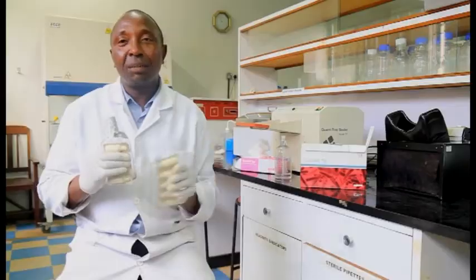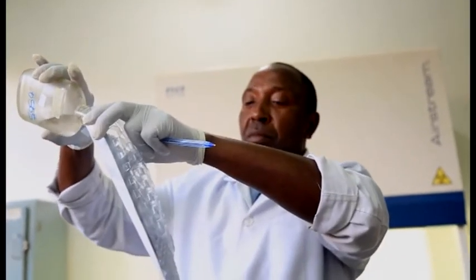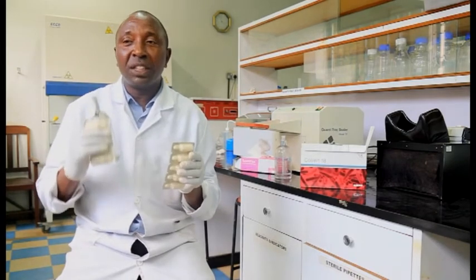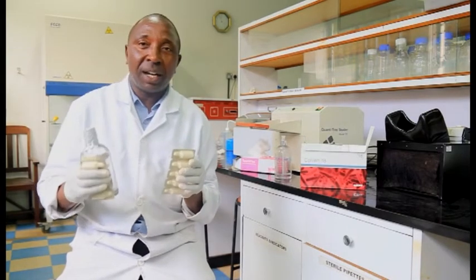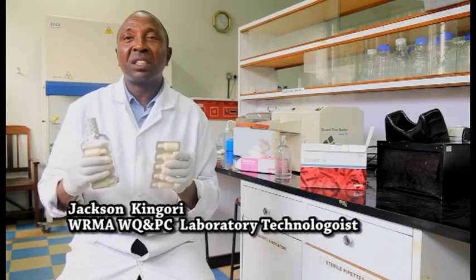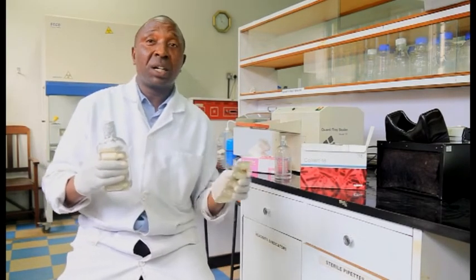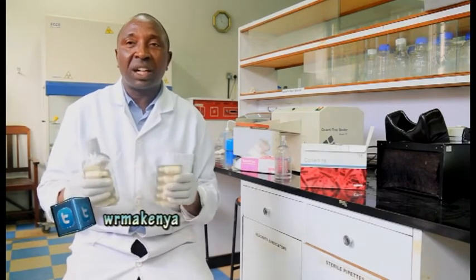That means because this test is 18 to 24 hours, within that time you have quantified the concentration of general coliform in a sample of water and the concentration of E. coli in that sample. By doing so, we have shortened the time we are able to advise our customers, let's say water treatment facilities or water companies.